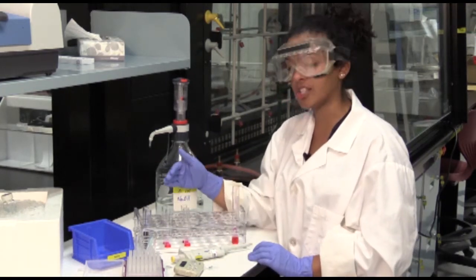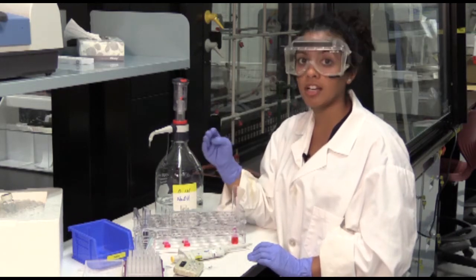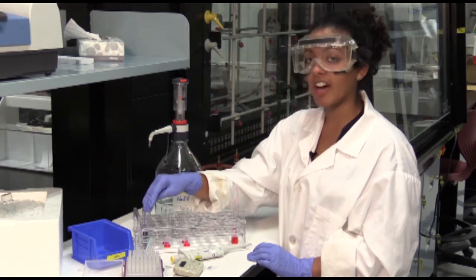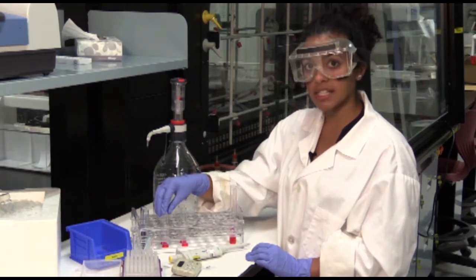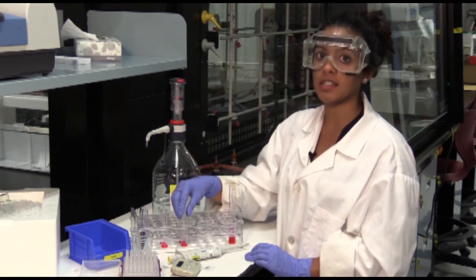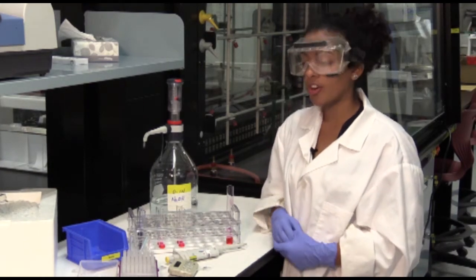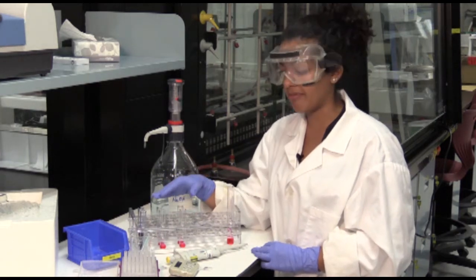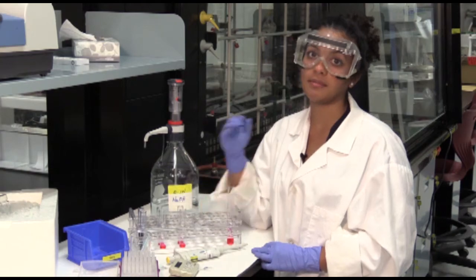And go through each test tube 30 seconds later in the same order that you started the reaction in. So it would be 5 minutes, 5 minutes 30 seconds, 6 minutes, 6 minutes 30 seconds, 7 minutes and 7 minutes 30 seconds. Remember that all of these test tubes have run the full 5 minutes. They've just been staggered by 30 seconds right at the start.